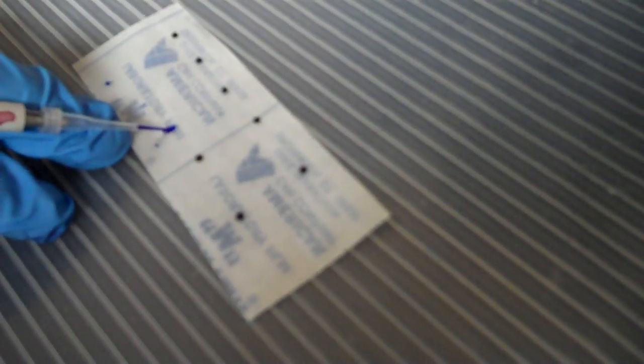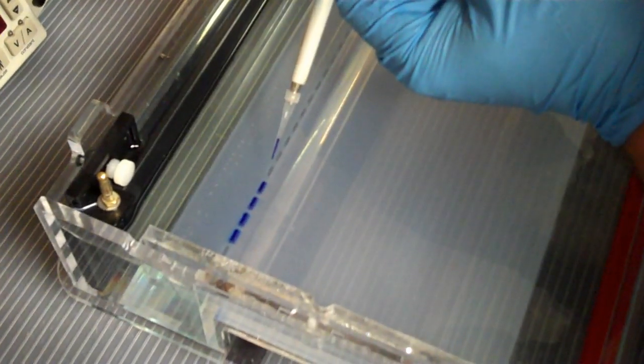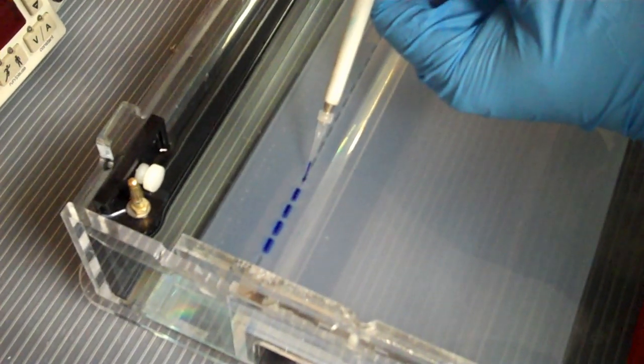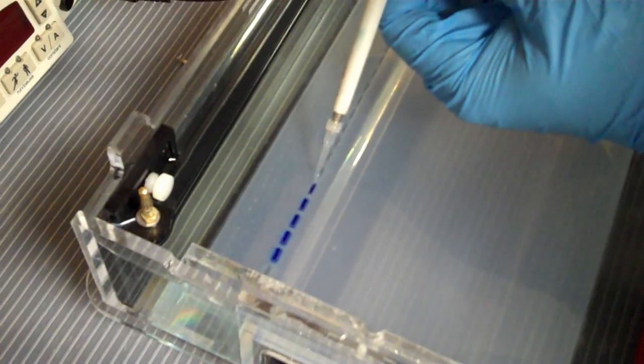Now pull it all up into the pipette tip. Put the pipette tip in the well and eject the loading dye slowly.